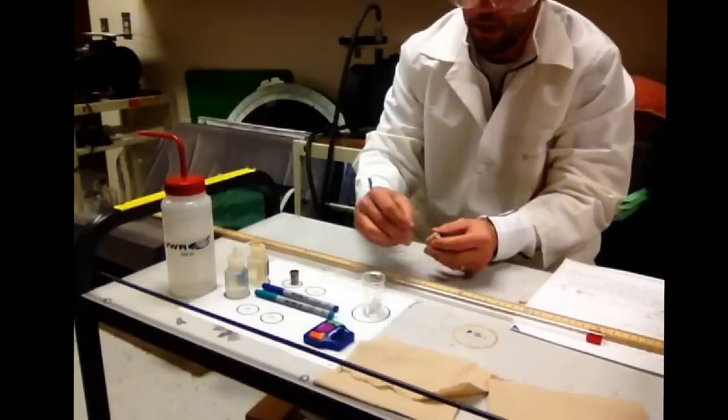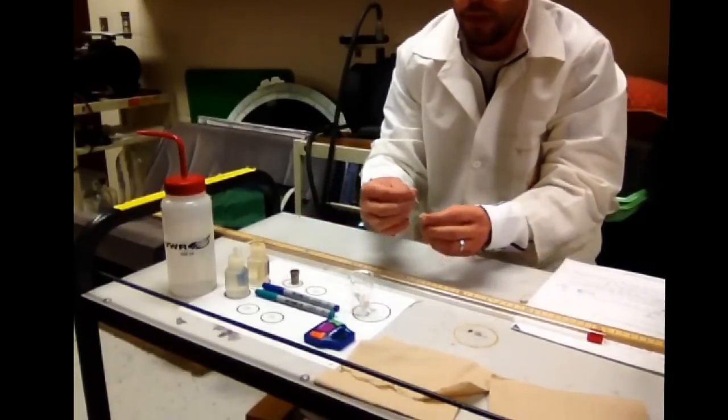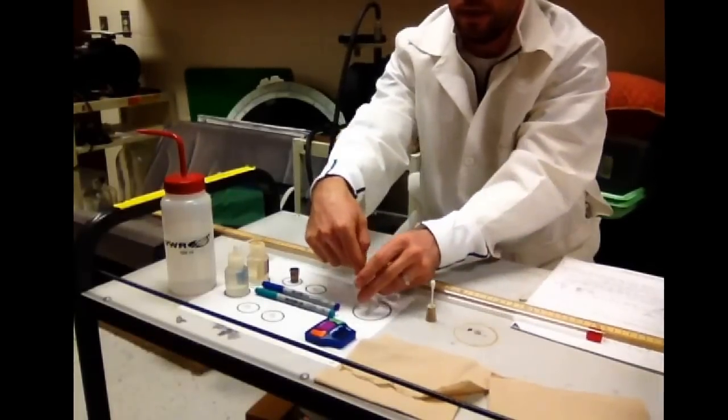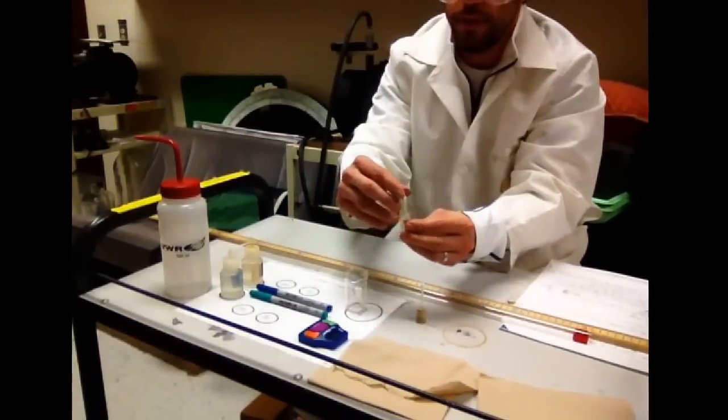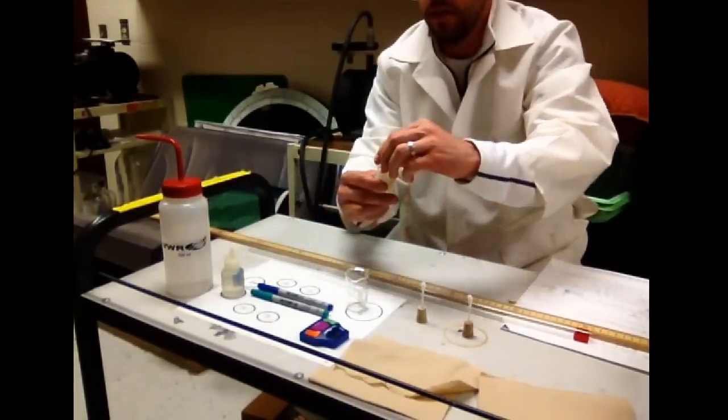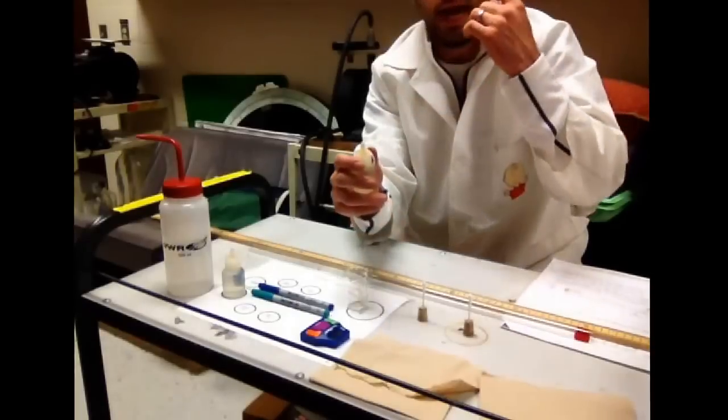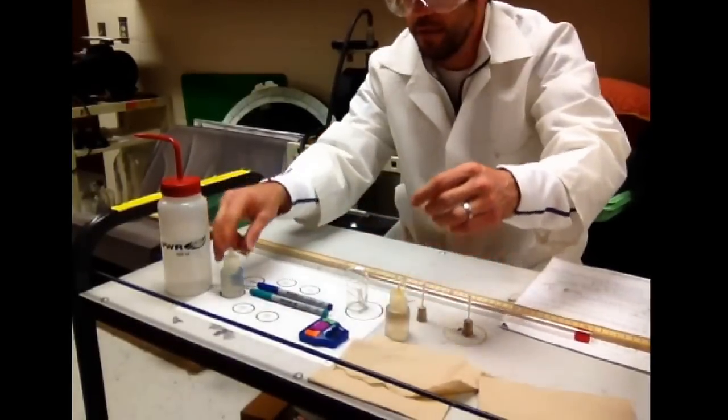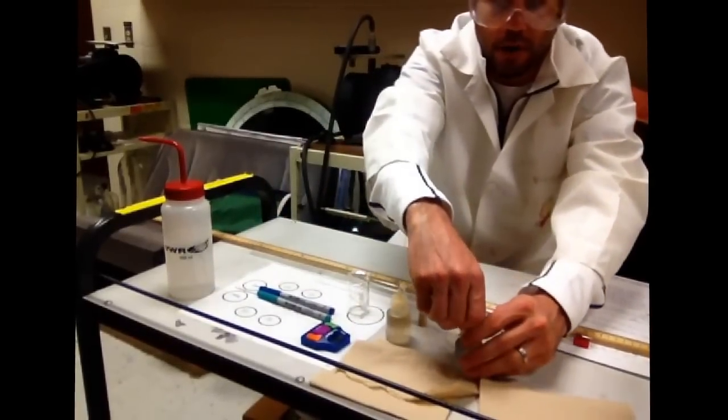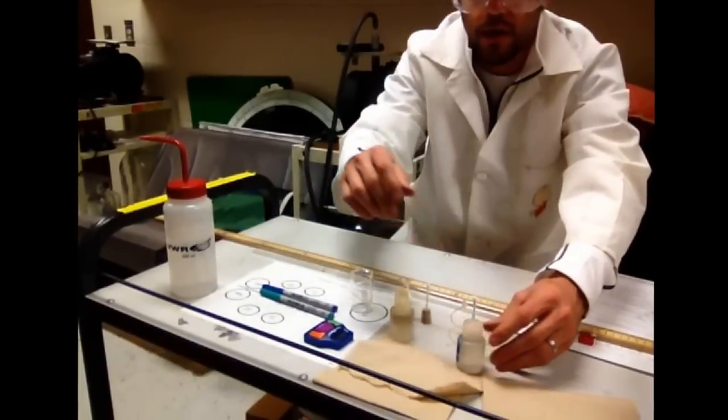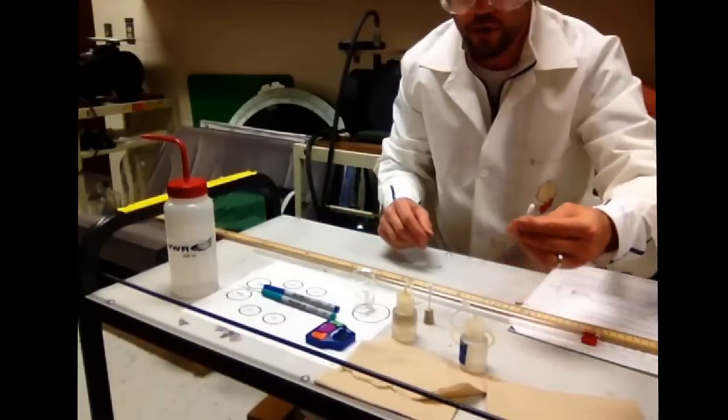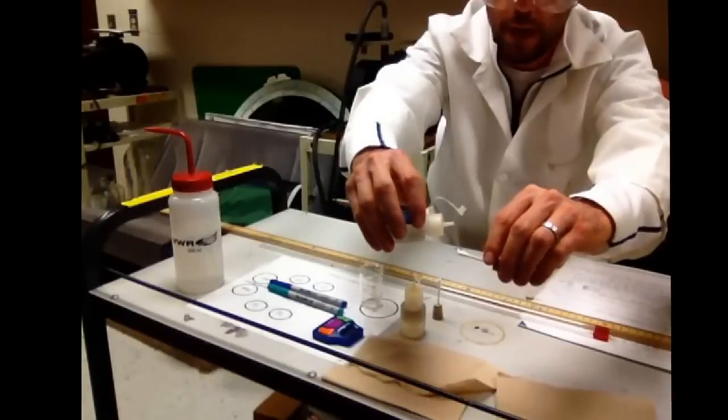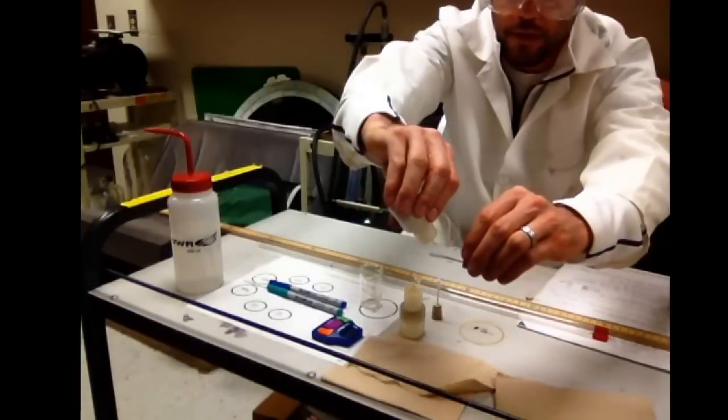So here's how we're going to do it. We're going to take the cork, take the Q-tip, place that inside there so that it's not going to fall out. Take the other Q-tip, place it inside of it. This is where you want to be careful. Goggles, safety goggles on. You're going to take this cap off. You want to be careful. Even the fumes could cause some harm. You want to take the concentrated lid off the ammonia. You're going to put a couple of drops. You will start to smell some fumes. Don't do this close to your nose. You're doing it away from the body.